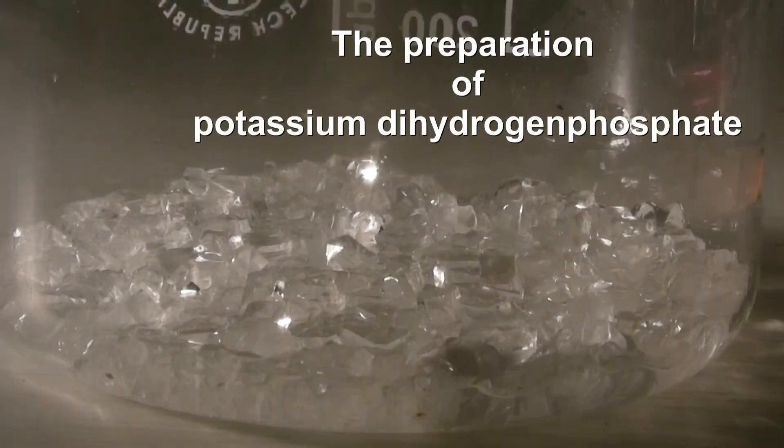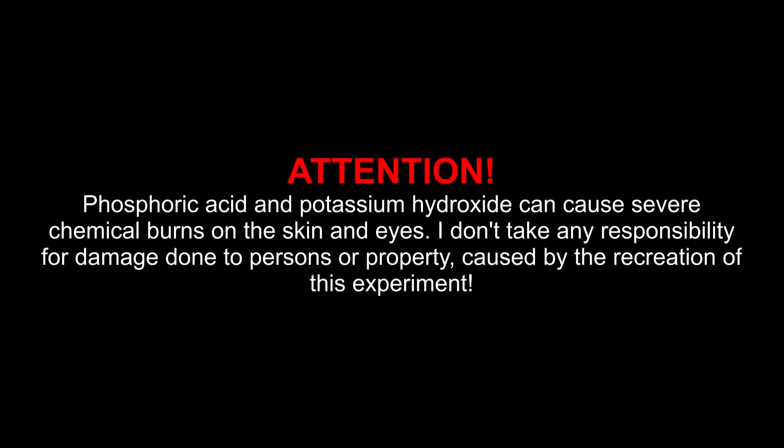The preparation of potassium dihydrogen phosphate. Attention! Phosphoric acid and potassium hydroxide can cause severe chemical burns on the skin and eyes. I don't take any responsibility for damage done to persons or property caused by the recreation of this experiment.